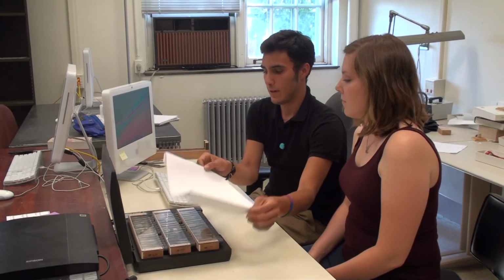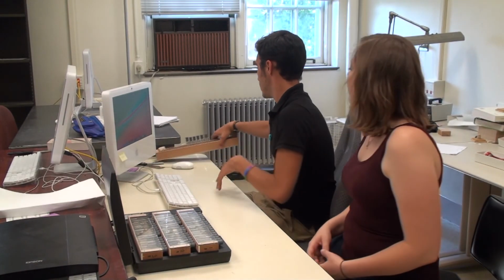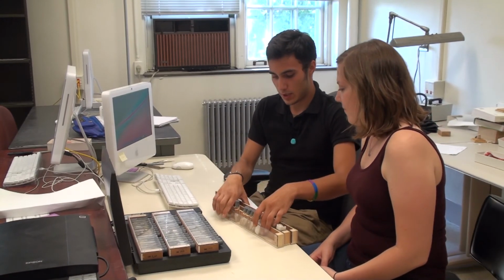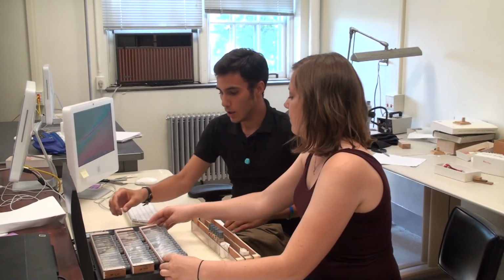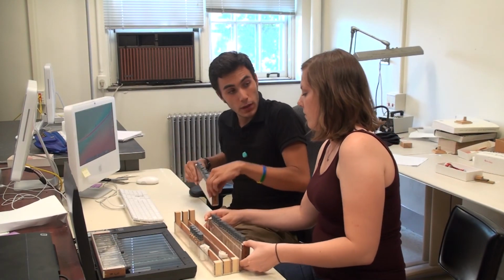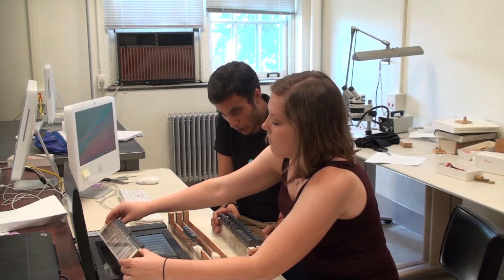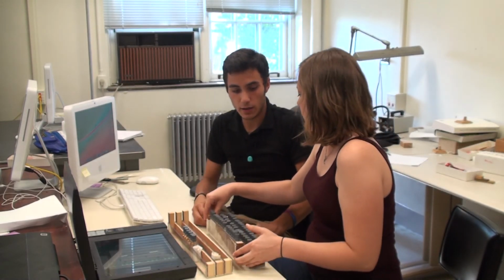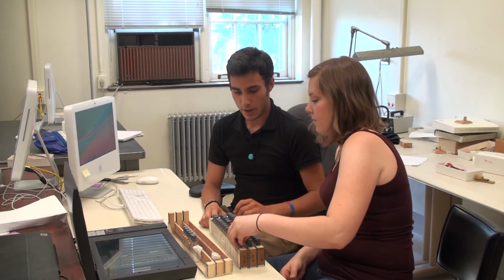All right, well, that's our first set of vials. It's so quick. It's really amazing. Now these images can be associated with each other and then eventually uploaded to InvertNet, and even for just collections purposes, parsed and assigned to that specimen's record in their database. So it's a very rapid way of taking care of this.